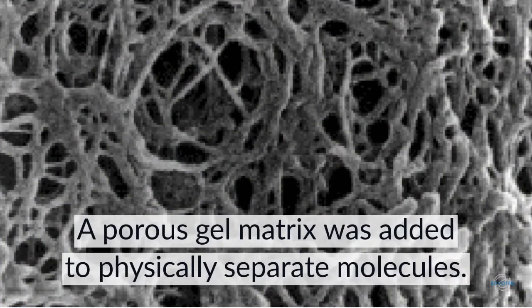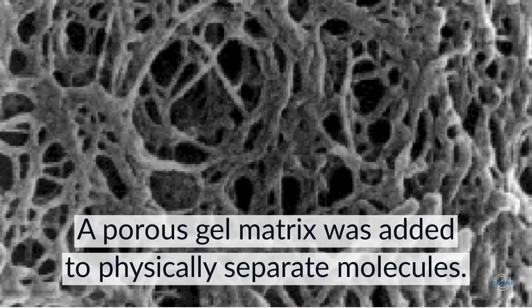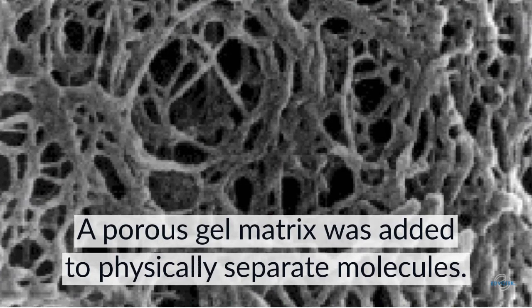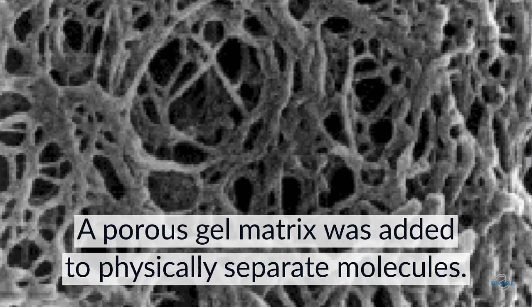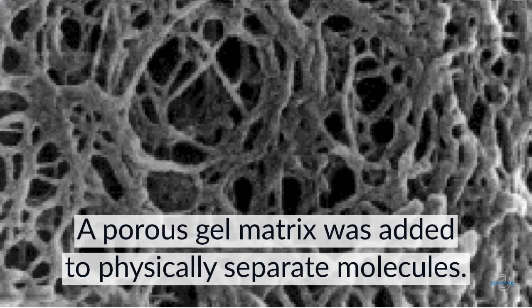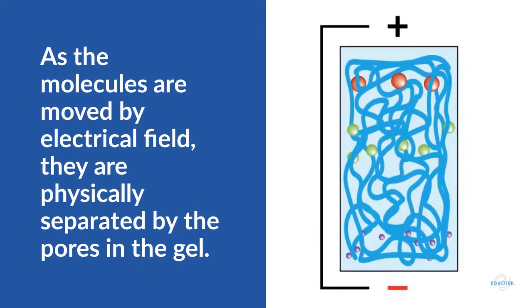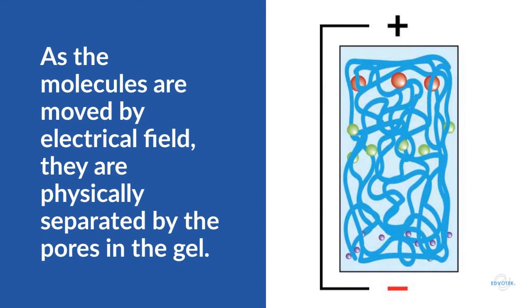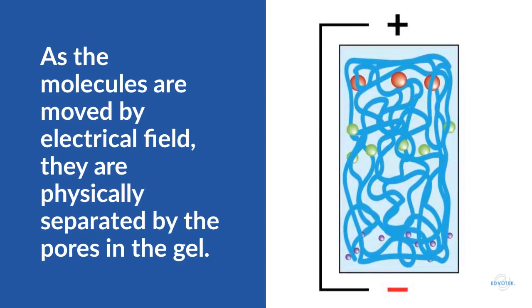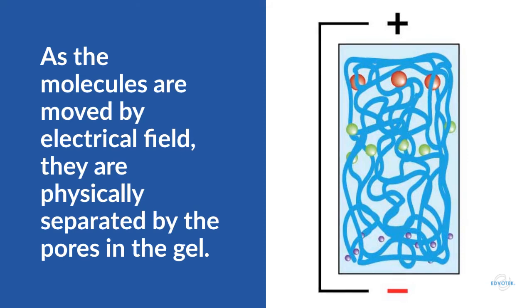One problem with moving boundary electrophoresis was that it didn't separate similarly charged molecules very well — they moved through the electric field at the same rate. To address this, researchers introduced a porous matrix to the electrophoresis system to physically separate molecules. The samples were loaded into the matrix and current applied. As the molecules are moved by the electrical field, they pass through the pores in the gel. Since it's easier for smaller molecules to move through the gel than larger ones, the molecules separate into bands by size, with larger ones near the wells and smaller ones further down the gel.